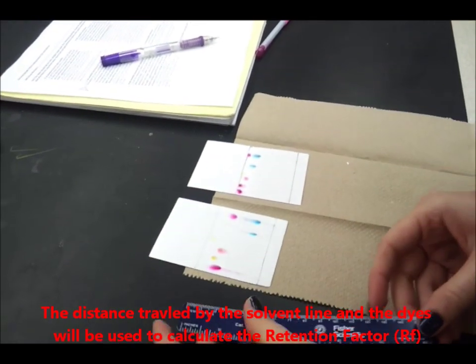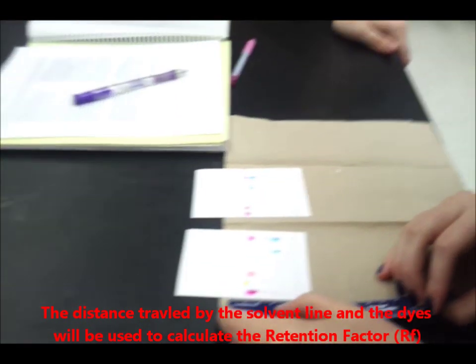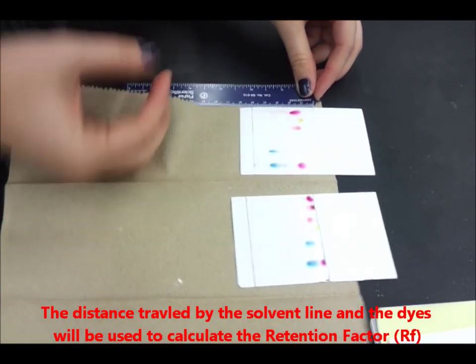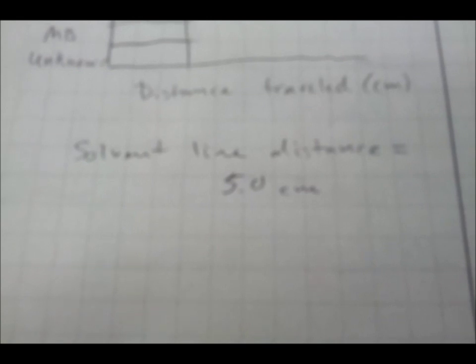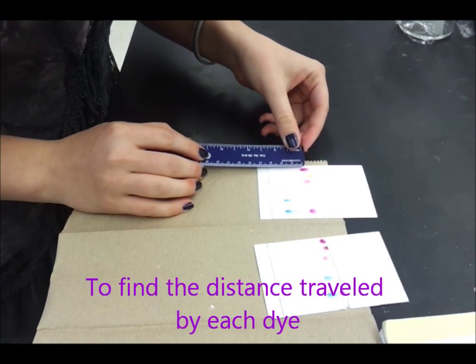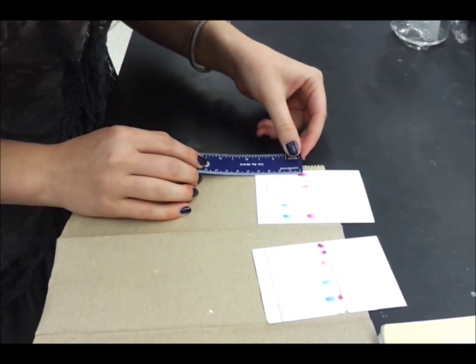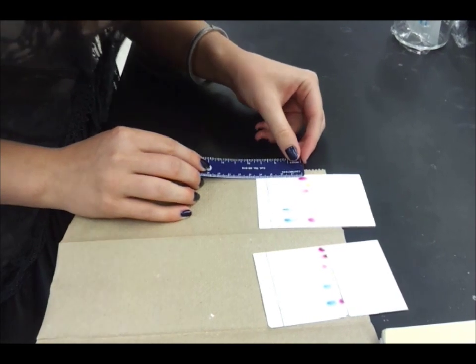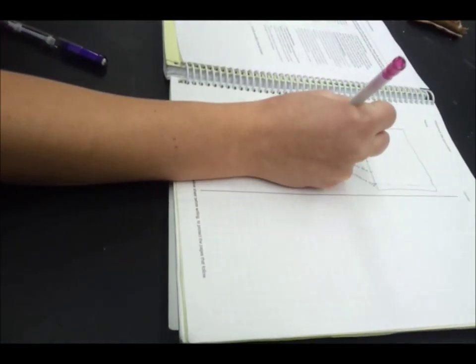So using the ruler, measure the distance from 1 centimeter of the bottom of the paper to the solvent line, which is exactly 5 centimeters. Then start at the middle of the dot and measure it to the 1 centimeter mark. So this is 3.4 centimeters. 3.7. Record all the distances traveled by the dots.